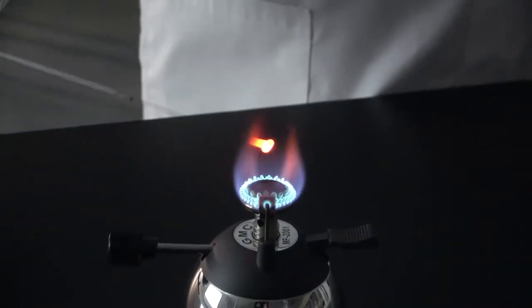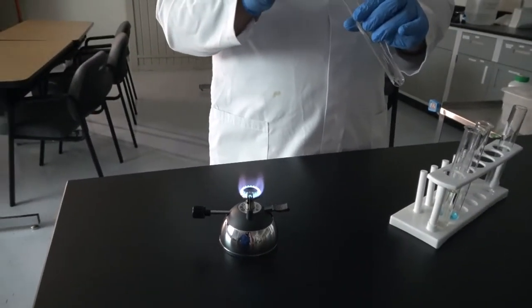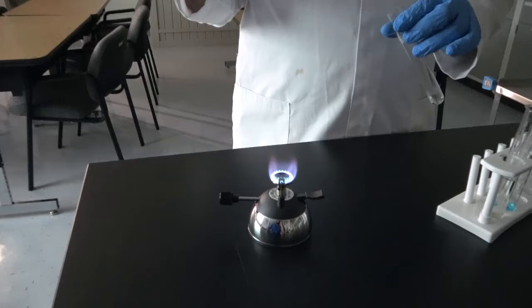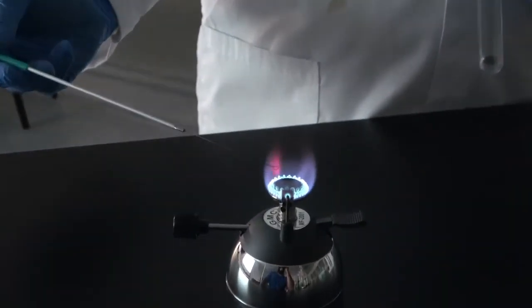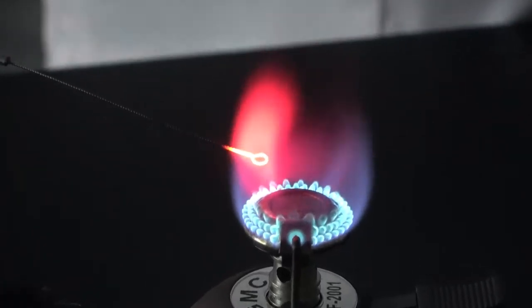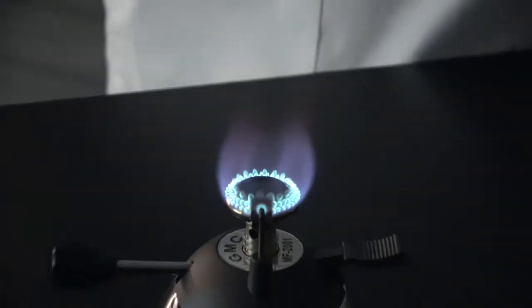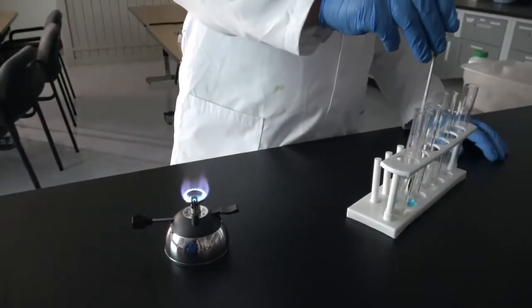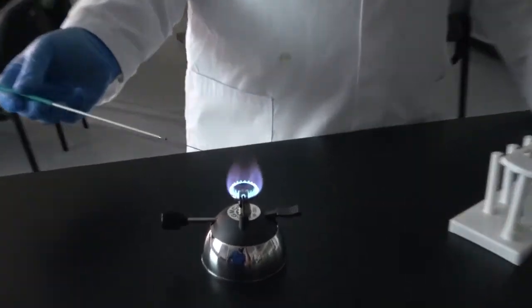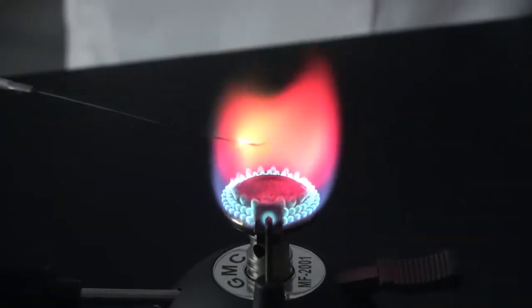And this is B now. Let's take a look again. B. Okay. Cleaning.